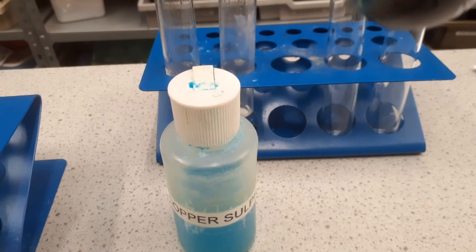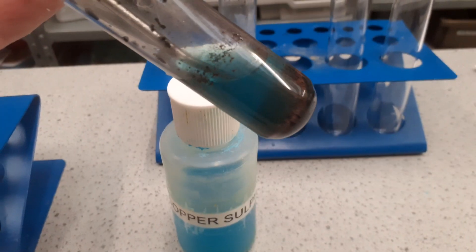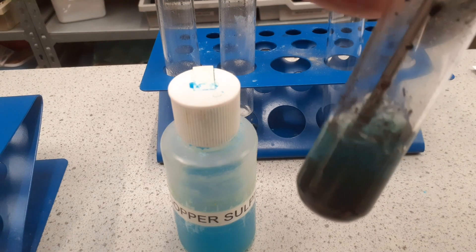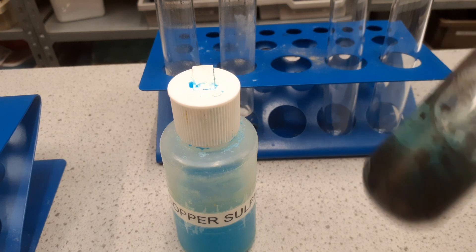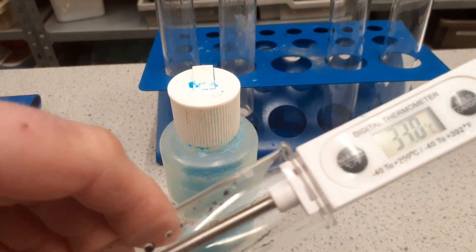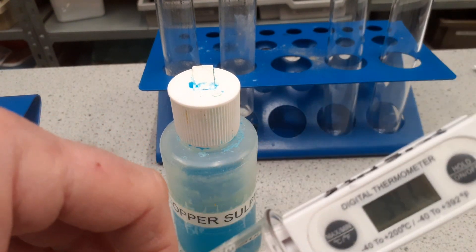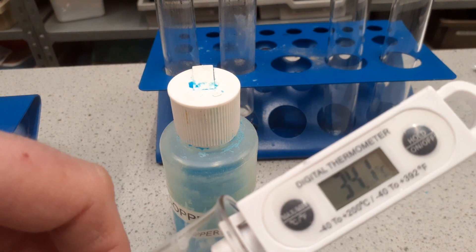Other evidence that there's a reaction occurring: if you look, you can see some reddish-brown copper which is being formed. The blue of the copper sulfate is getting lighter. As you remember, this is a displacement reaction. The reaction is getting finished and the temperature is 34.1 degrees.